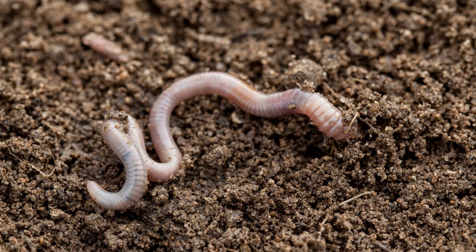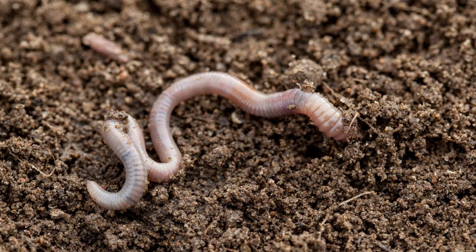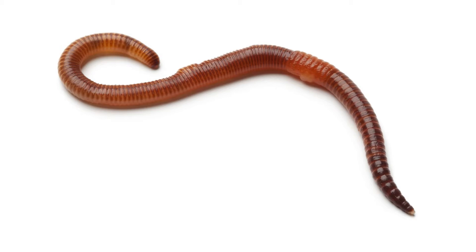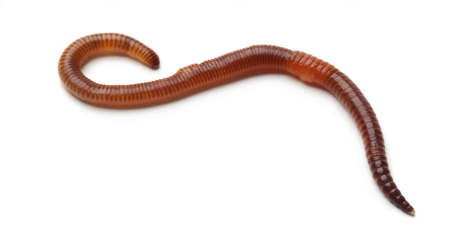Through its consumption of leaves it changes the food chain, and through its interactions with seeds it changes the native flora. The common earthworm is elongated and cylindrical, with a pointed front and a flattened, blunt rear end. Under the slightly iridescent cuticle it is reddish to brownish in colour, with the front half of the back being distinctly darker to brown-purple, and getting lighter towards the rear.